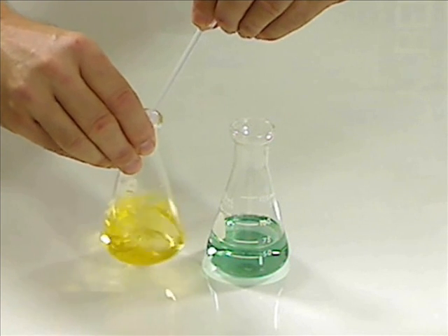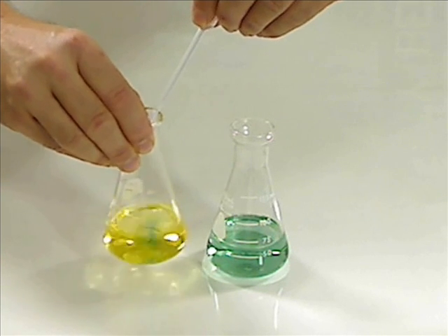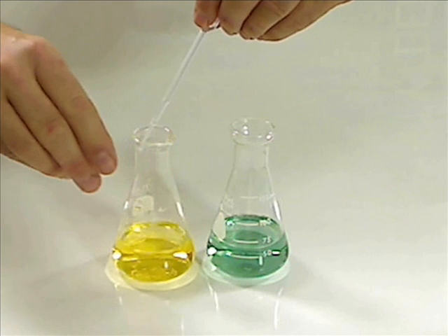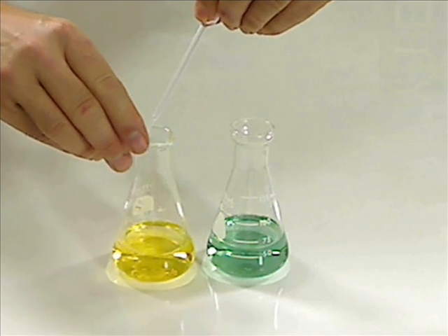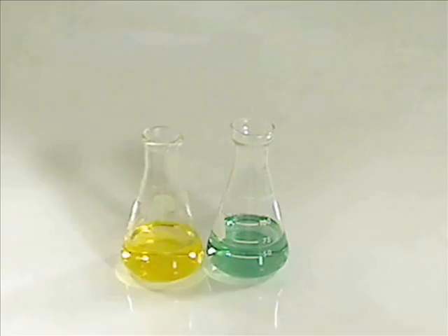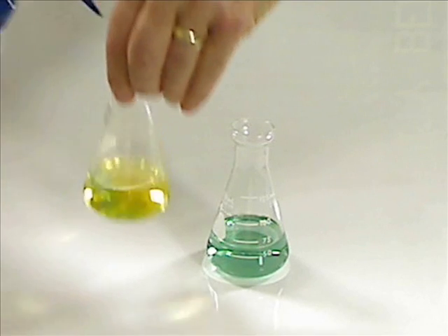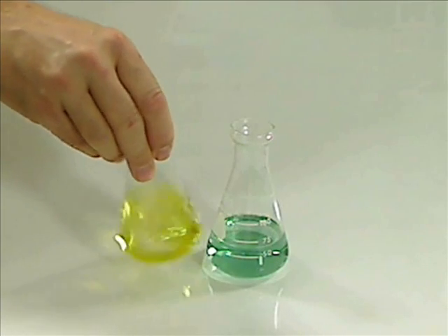You can start seeing the green appearing, but then also going away. Getting very close to the end point. Every once in a while, you're going to want to take some DI water, wash down the sides, and make sure you have all the titrant off the sides.